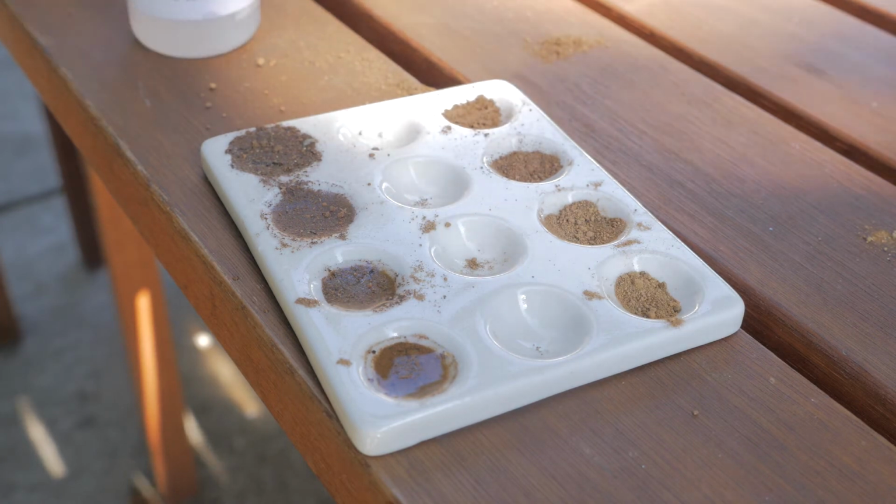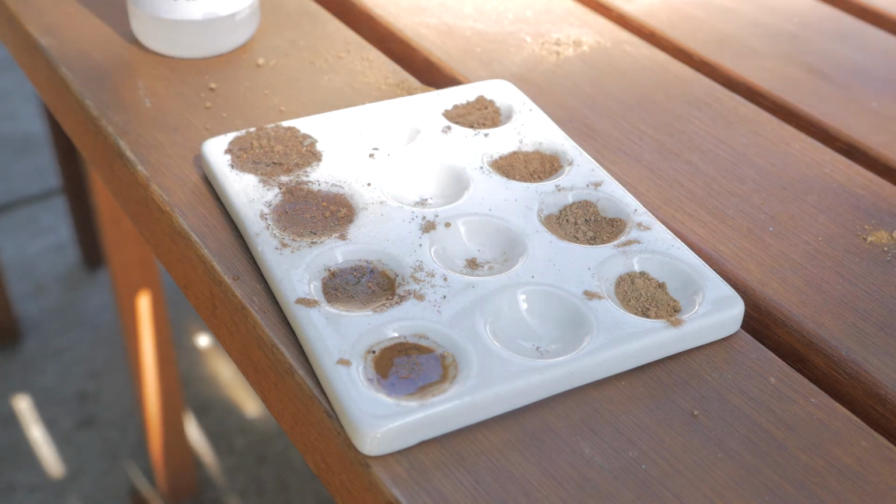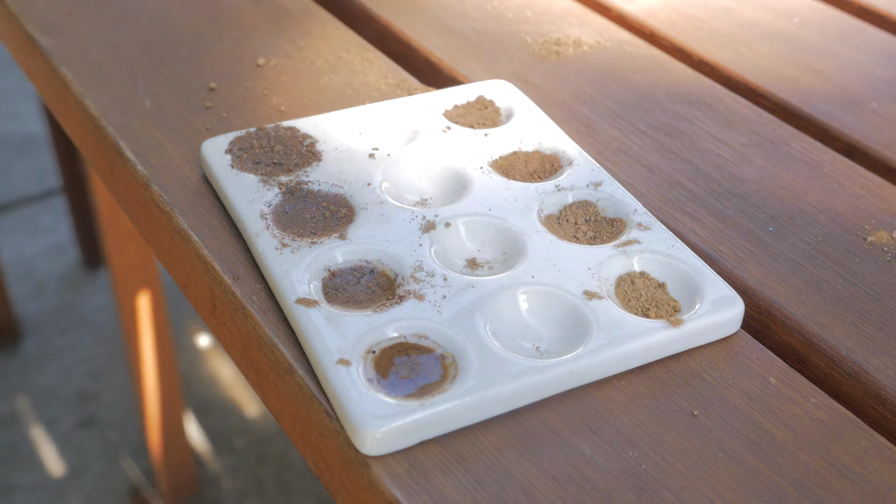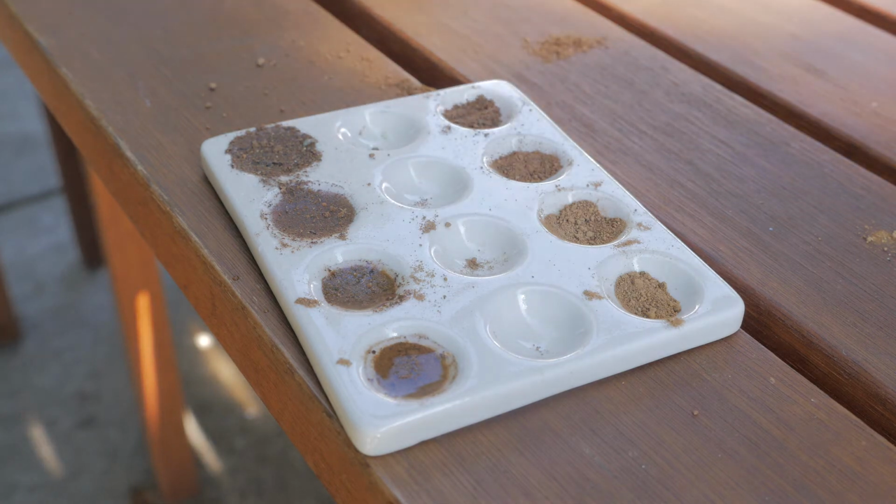Okay. So the sodium fluoride needs to react for about 20 minutes. The water can do about 5 minutes. It's all equilibrium reaction, so it doesn't matter if you let it go longer. So we're going to set the timer for 30 minutes on these and then come back to them.